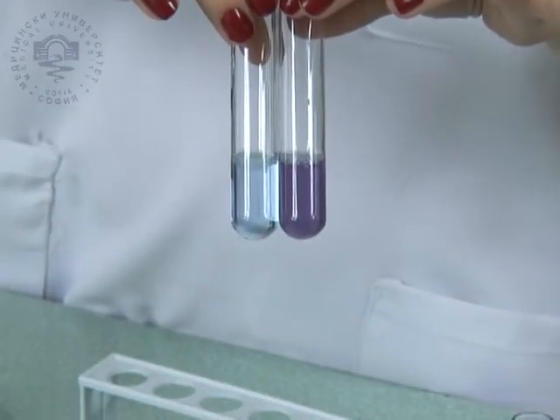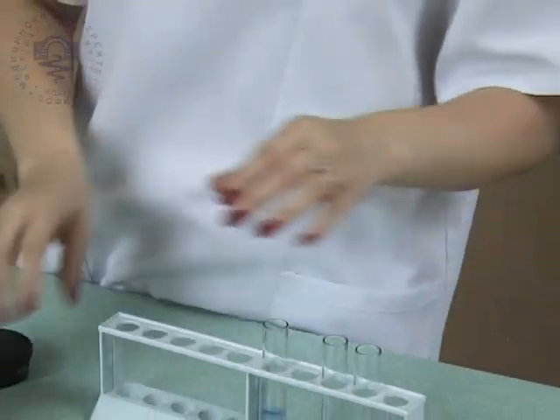The color of the biuret reagent can be seen in the control test tube.